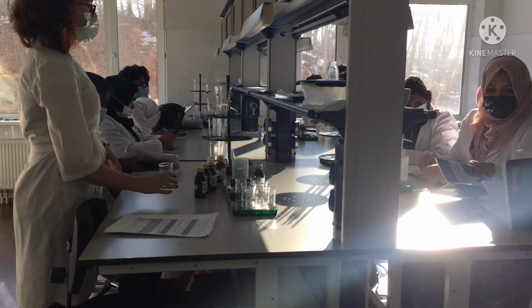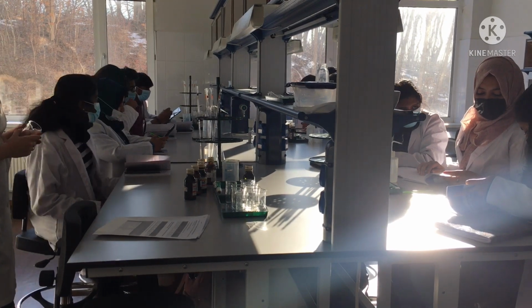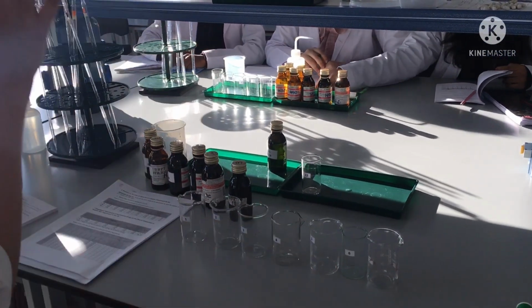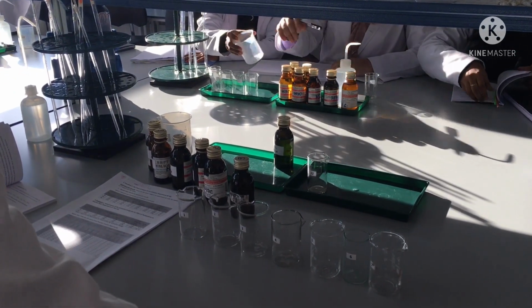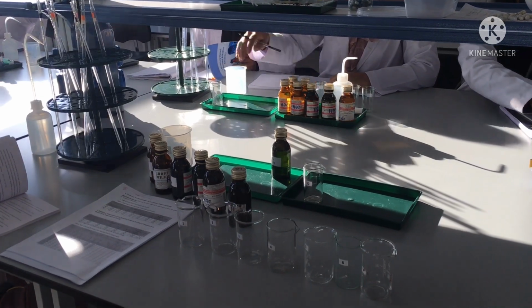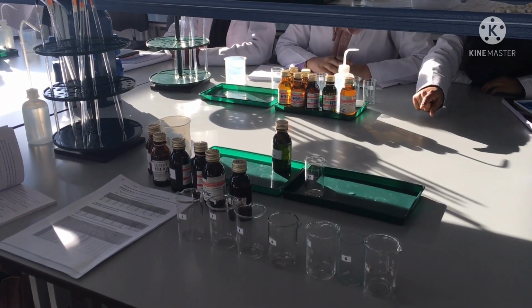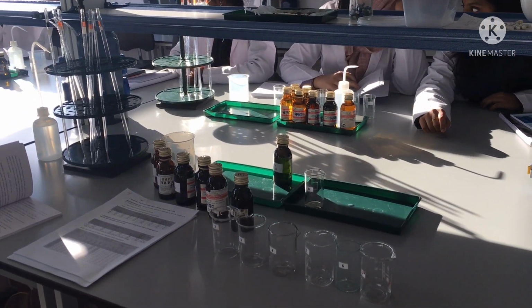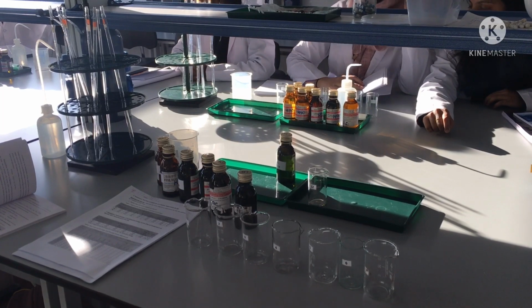And now we will prepare the mixture. Okay, let's start. Please put the beakers in a row from 1 to 7. We will have 7 trials in the A series. And we need to prepare the chemical mixture using the pipettes. Here you can see the sign. If you have any question about what is written, you need to ask. Yes, please? We have to use chalk to label them, or should they be labeled already? It's not. If it's not, you can write it down with the chalk.